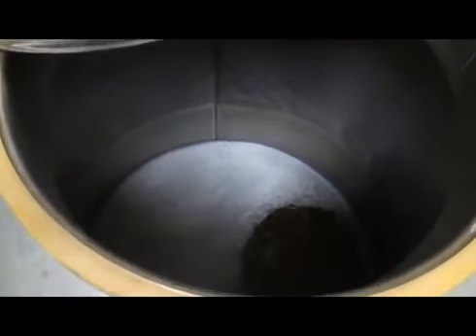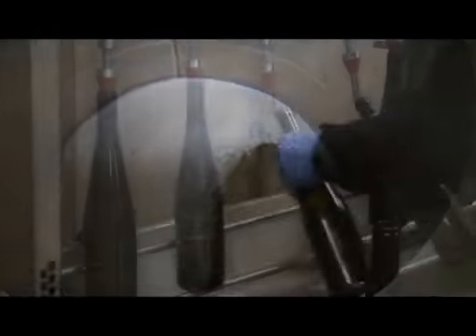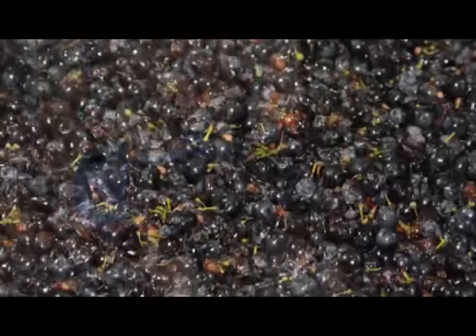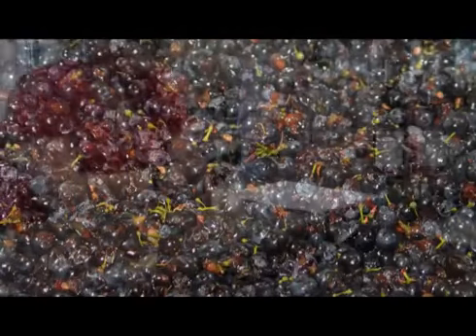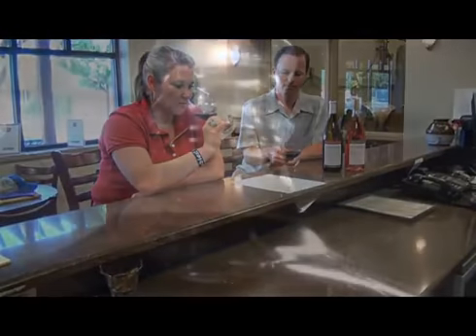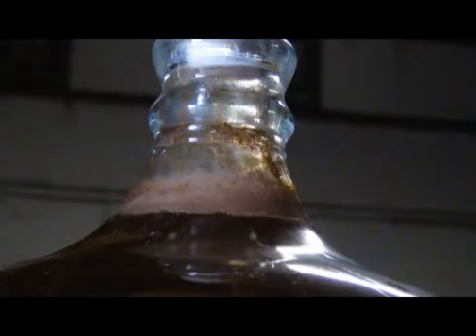The acids in wine are an important component in both winemaking and the finished product of wine. They are present in both grapes and wines, having direct influences on the color, balance, and taste of the wine, as well as the growth and vitality of yeast during fermentation and protecting the wine from bacteria.